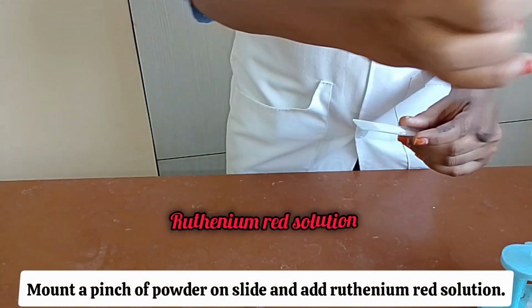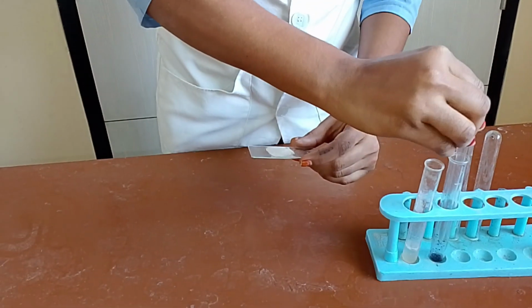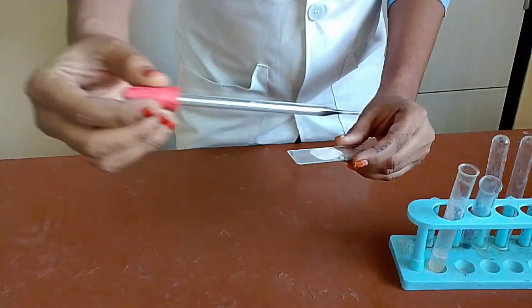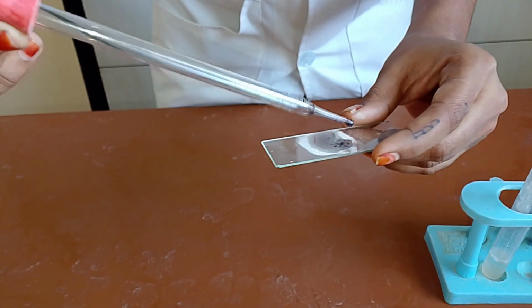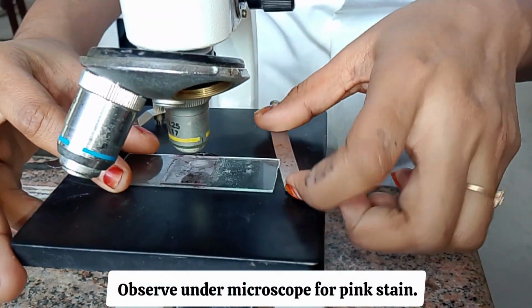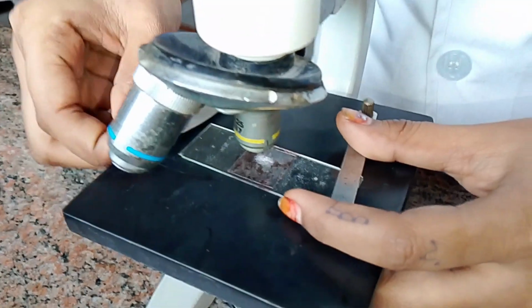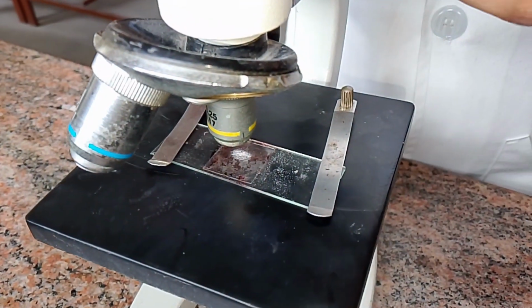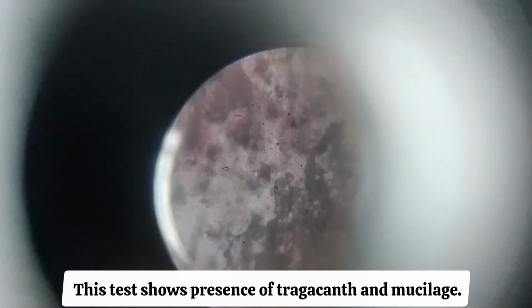Mount a pinch of powder on slide and add ruthenium red solution. Observe under microscope for pink stain. This test shows presence of Tragacanth and mucilage.